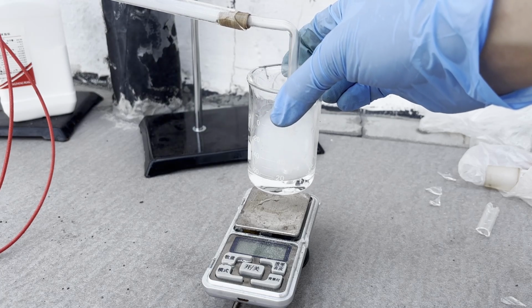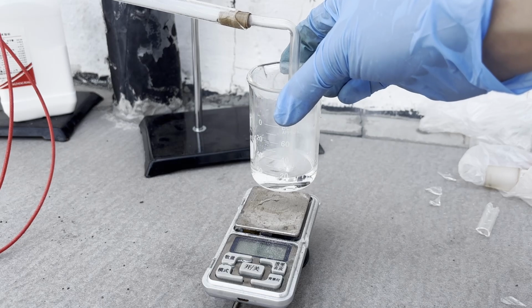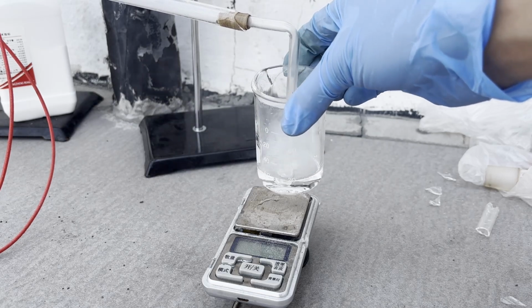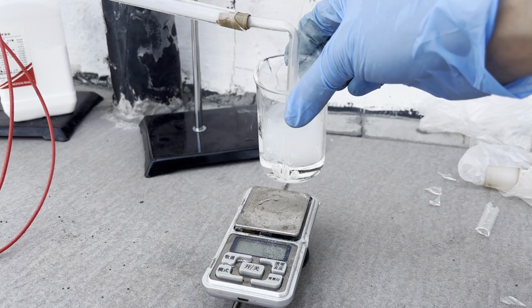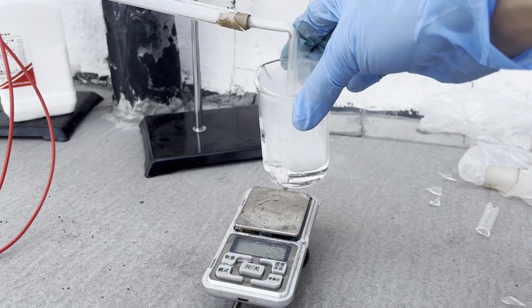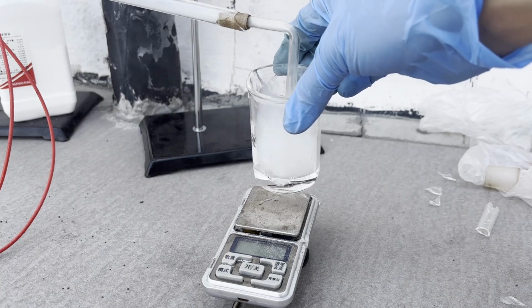Of course, using concentrated 98% acid to absorb the sulfur trioxide is obviously more efficient and, to be honest, necessary if you're replicating this process. But anyways, that's all I've got for the process now. I still need to optimize the process regarding the collection of sulfur trioxide, but at least another amateur-friendly route to access sulfur trioxide is documented.